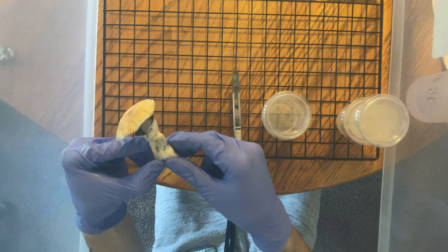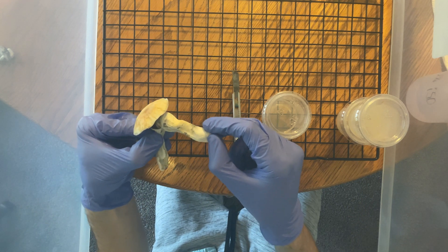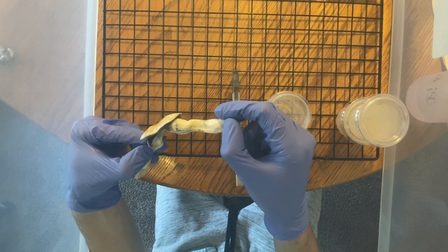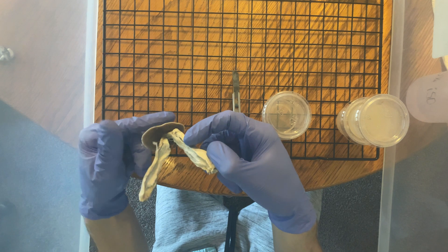Try your best and not get too many spores everywhere, as this is supposed to be a sterile work environment. Sadly, when you deal with fruits that drop spores, there's probably already many of them in this SAB. I might cut off the cap next time and still take it away from the stipe, but we'll see.